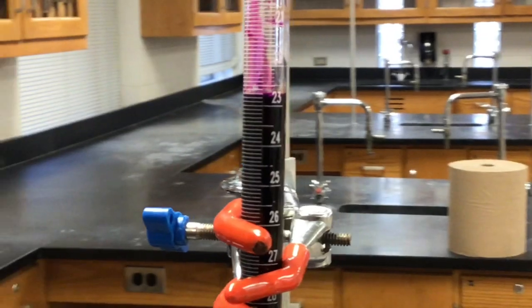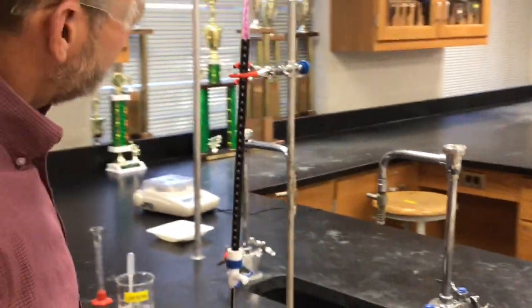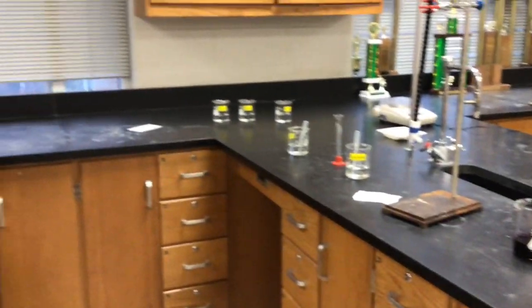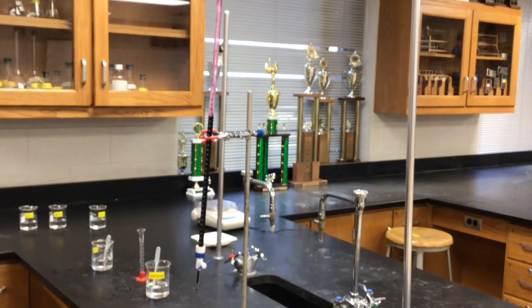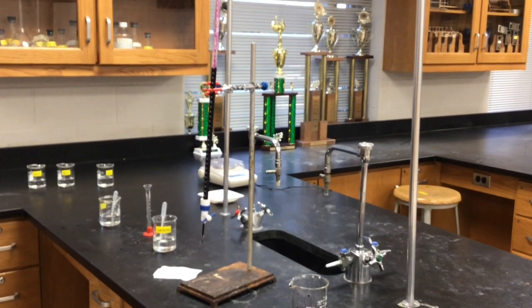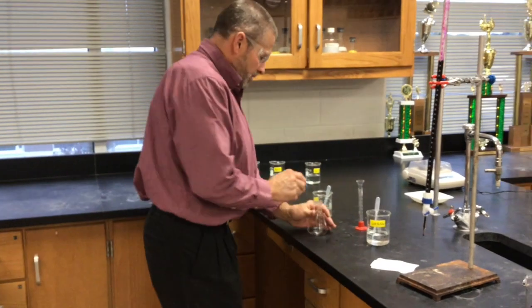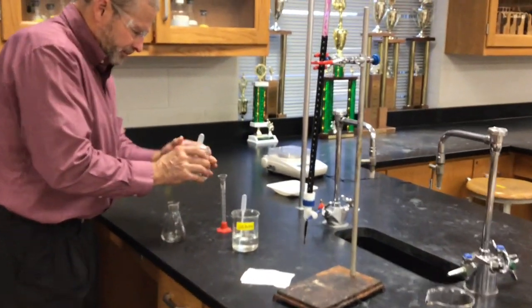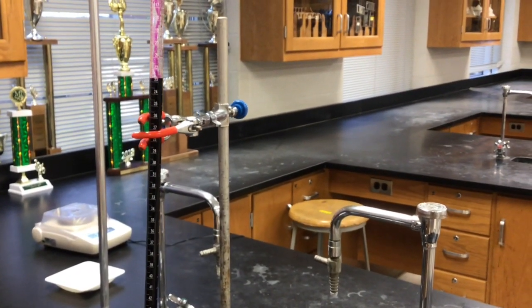Okay, so there's our final volume. Initial volume was 0. All right, so let's reload and give you one more trial. We'll call that one trial 2 because trial 1 was done off the camera. Now, if we had gone over 25 milliliters, we would have to refill the burette, but I think we're good.